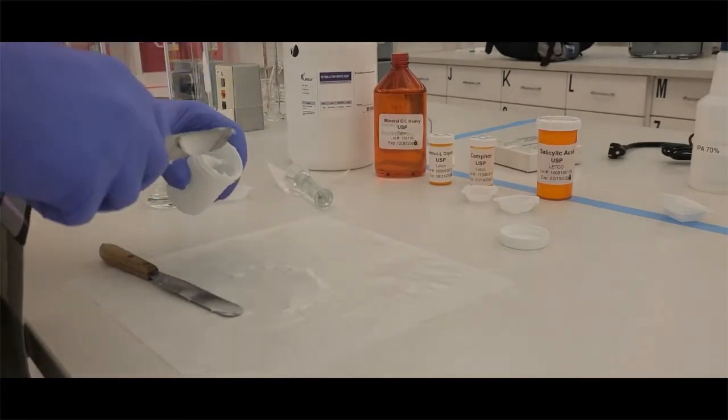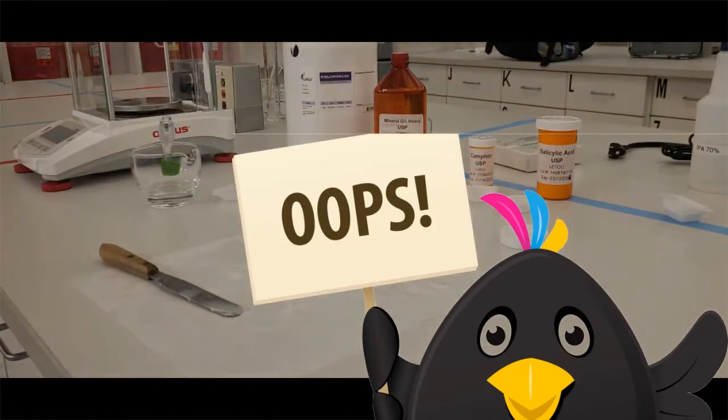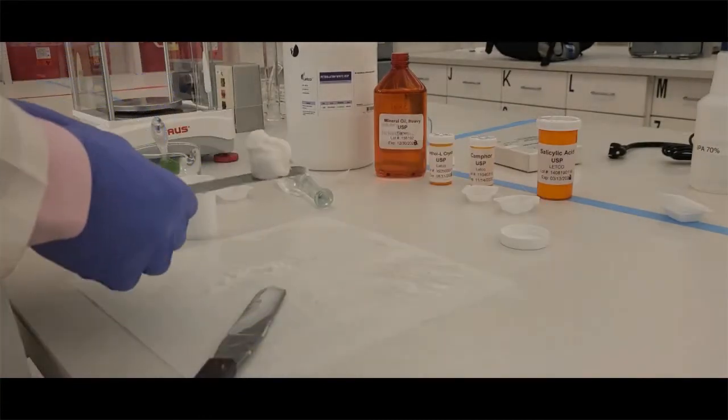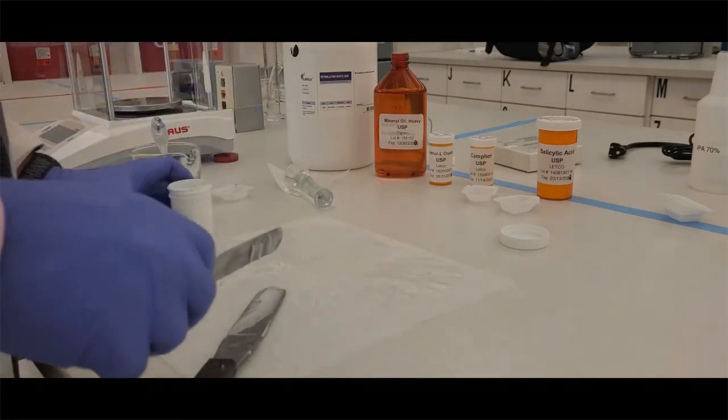Don't do what I do here, which is slippery hands. Whoops. You don't want to do that. So let's try that over again. Make sure that you've cleaned your hands off if you need to change your gloves and place that ointment into the ointment jar.